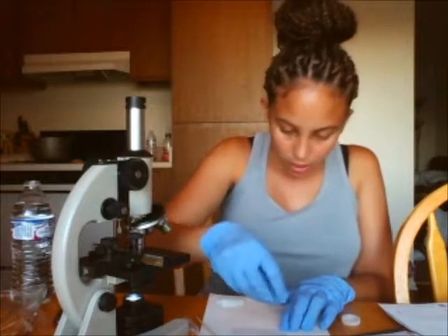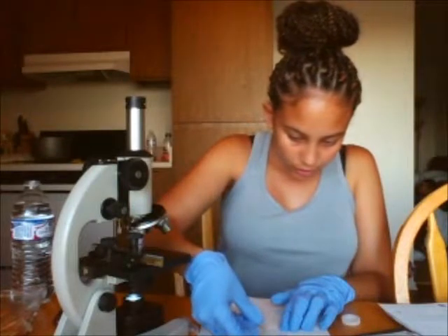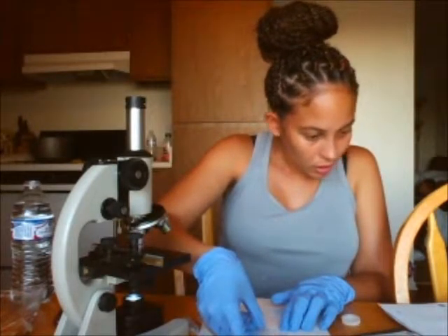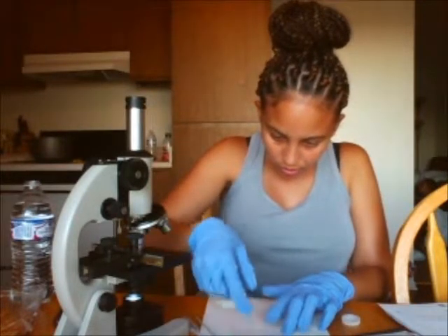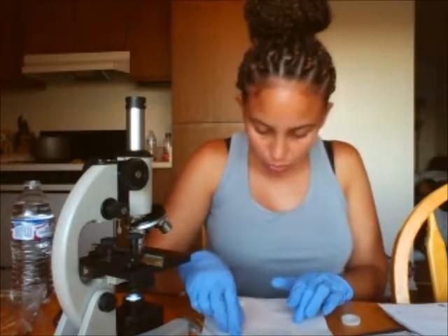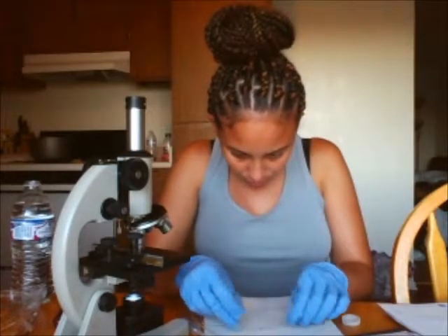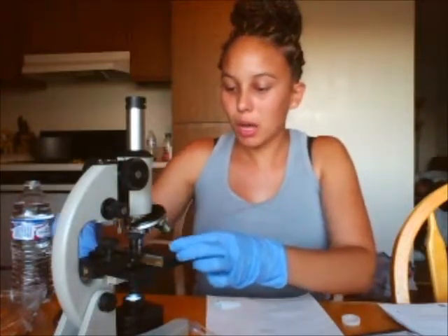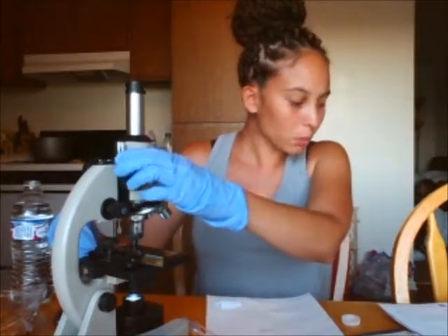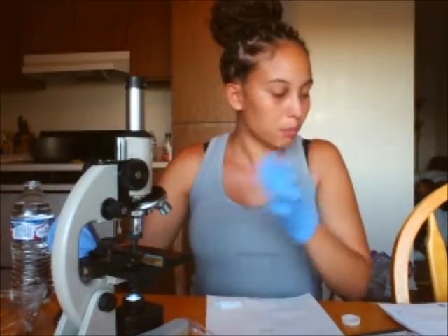Okay, and then to take my cover slip and hold it upright and slowly lower it on. Okay, and it says to remove any excess water. Doesn't look like there's any excess water, but I will do that. And then I'm going to put it here and prepare it on my microscope and go through my scanning all the way to my immersion oil and take my photos, and I will do the same for the plaque on my teeth.